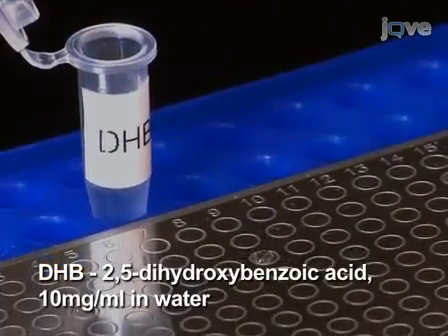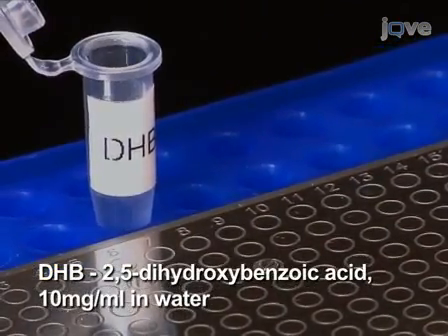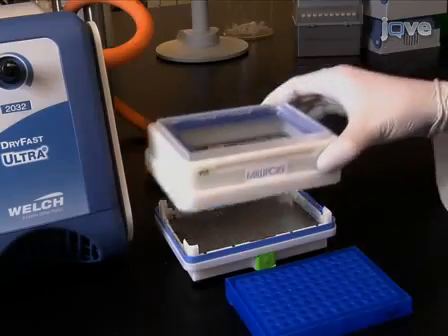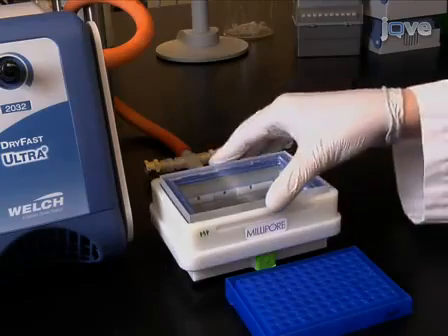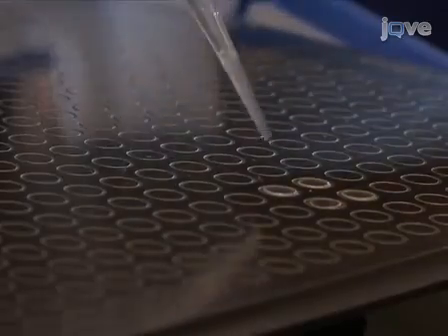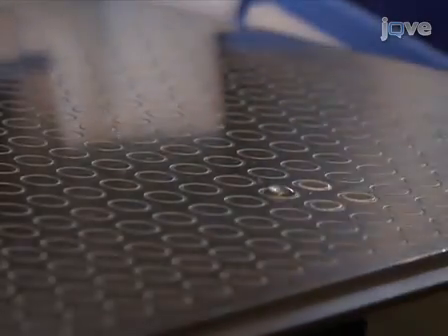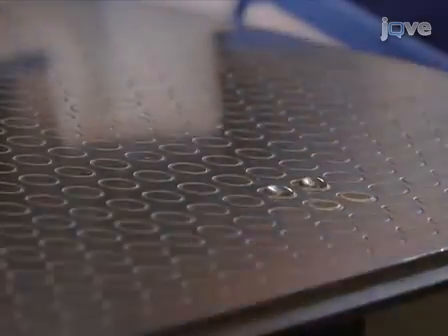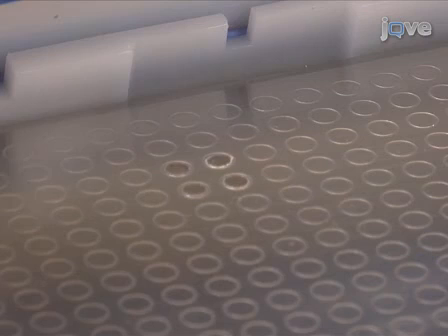While the digest is incubating with the beads, spot 2 microliters of DHB matrix onto a MALDI target plate. Evaporate the matrix solvent under vacuum, leading to matrix chemical crystals. Now spot 2 microliters of the desalted digest solution on top of the matrix crystals on the target plate. The solvent of the sample matrix spot is again evaporated under vacuum.